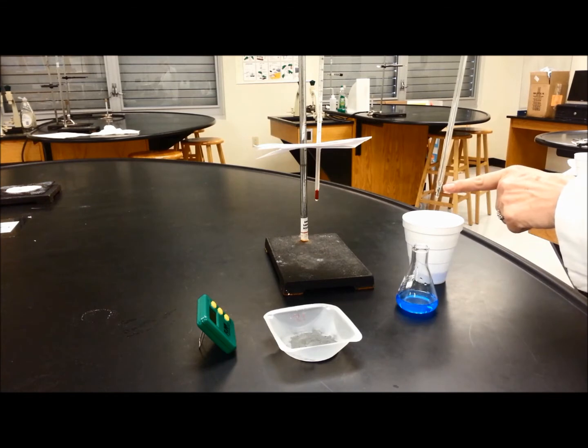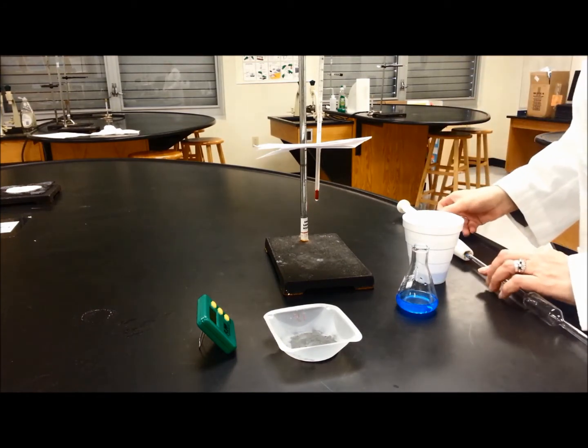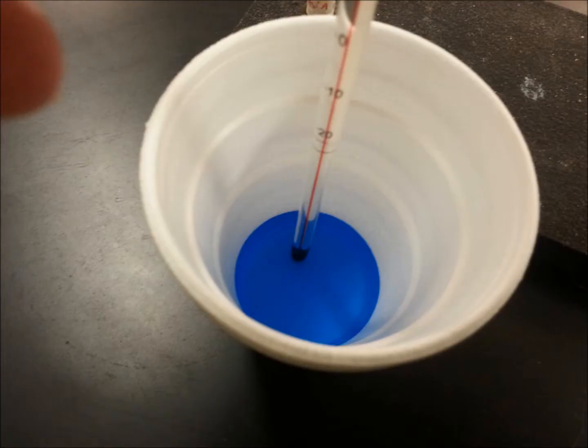The last drop is supposed to be here so we are not going to force it down. Be sure that the liquid touches the thermometer but the thermometer is not so low that it can damage the styrofoam cup.